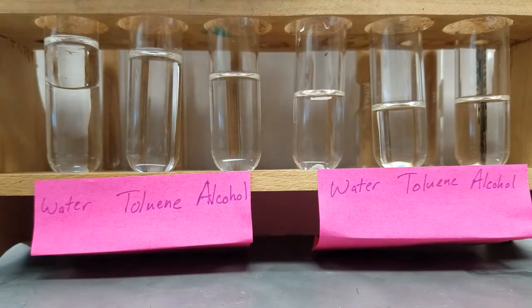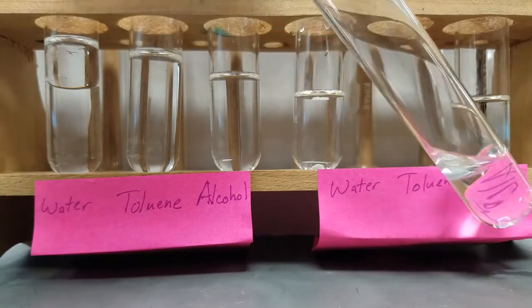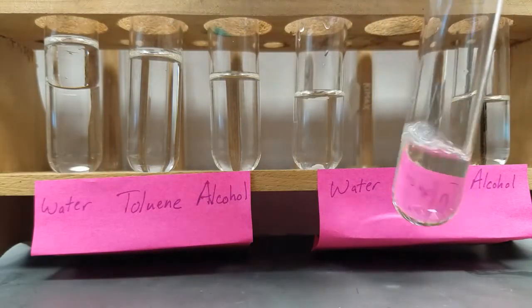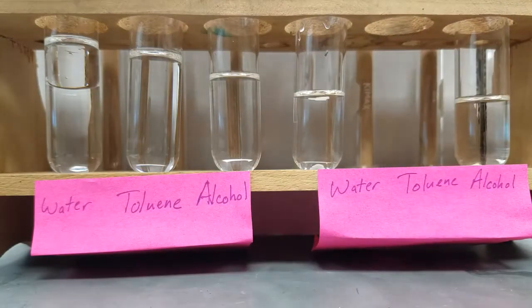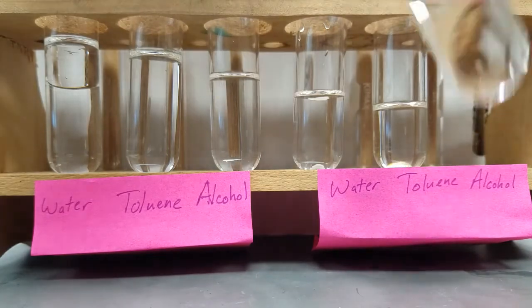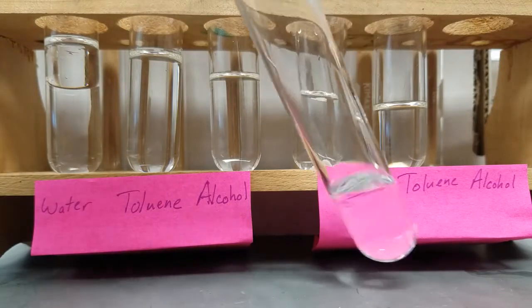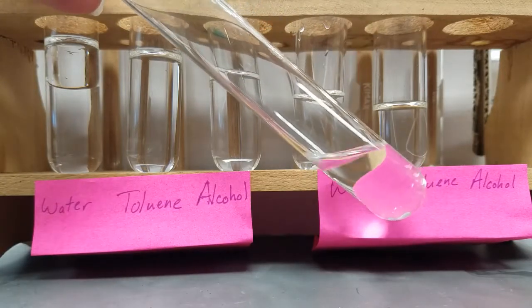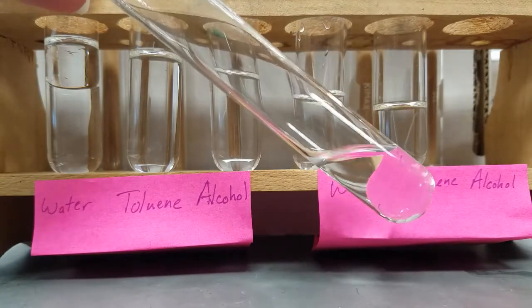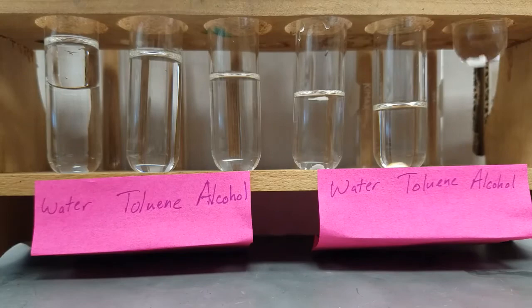This is insoluble in water. If we look at the toluene, there are no crystals left — so the naphthalene is soluble in toluene. And if we look at the alcohol, there are a few white crystals left in the bottom, but they're smaller than what we added, so this is partially soluble in alcohol.